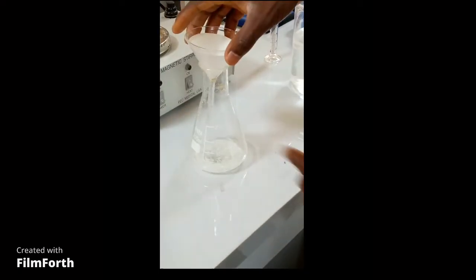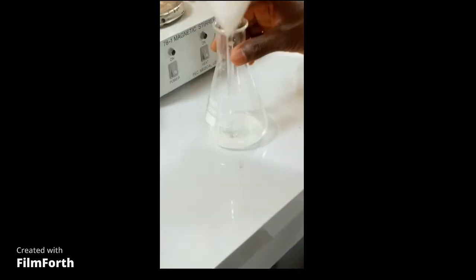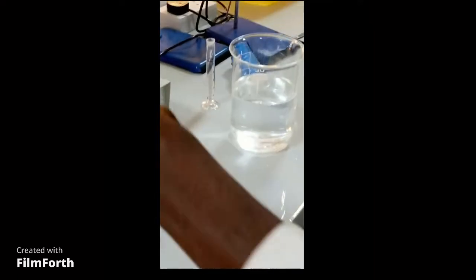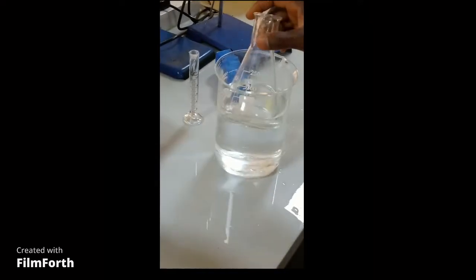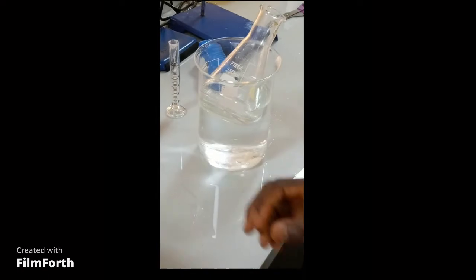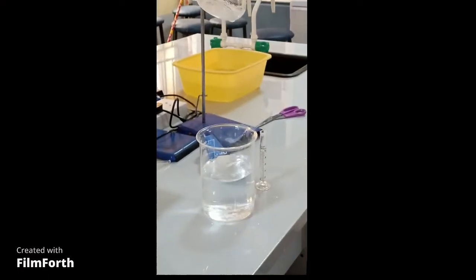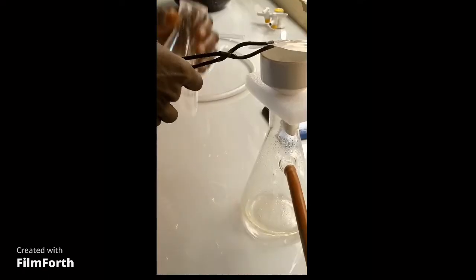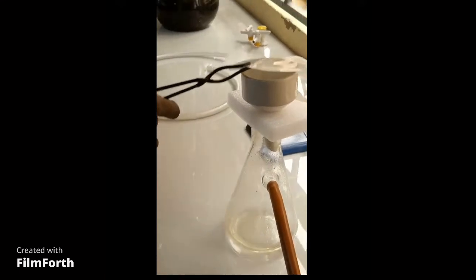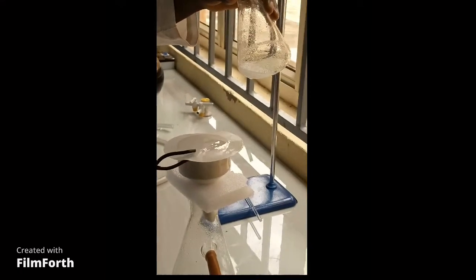The product is in the filtrate. We put it on an ice bath to induce the formation of the product. The product is ready. We filter by suction — filter out the product by suction.